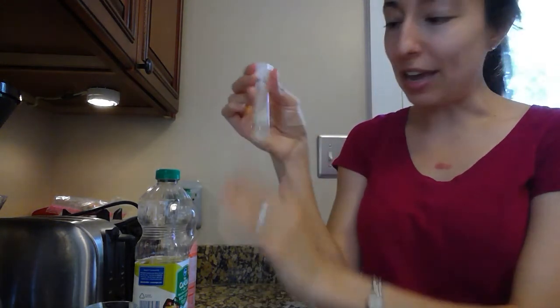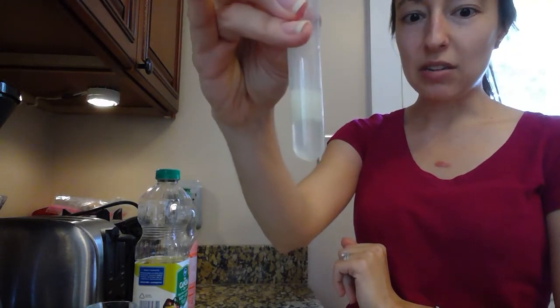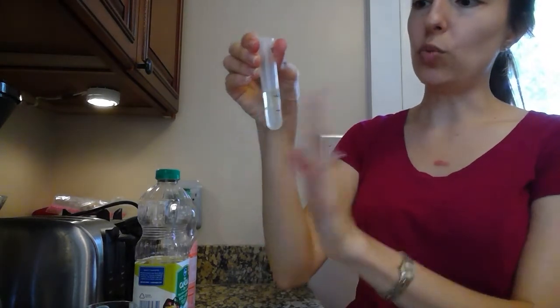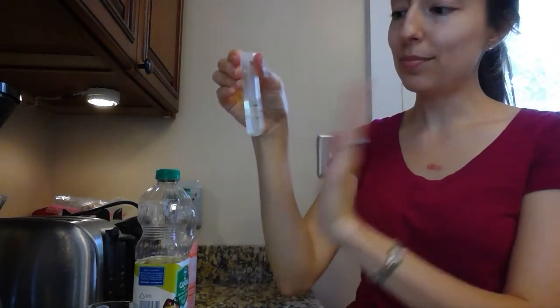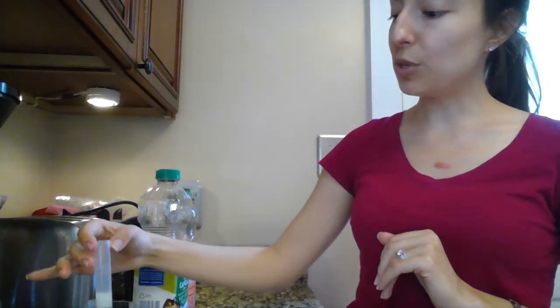Kind of think of a cat playing with a toy, all right? And then think about what you see. Did it change at all? And you're going to do that for both of your test tubes. So do your nice finger flicks about the same amount of times for each one. And of course, make sure you're holding that top end so you don't flick it across your room, right? Okay. So take some time to observe your individual test tubes. What do you notice? That's going to be your table under number 3.